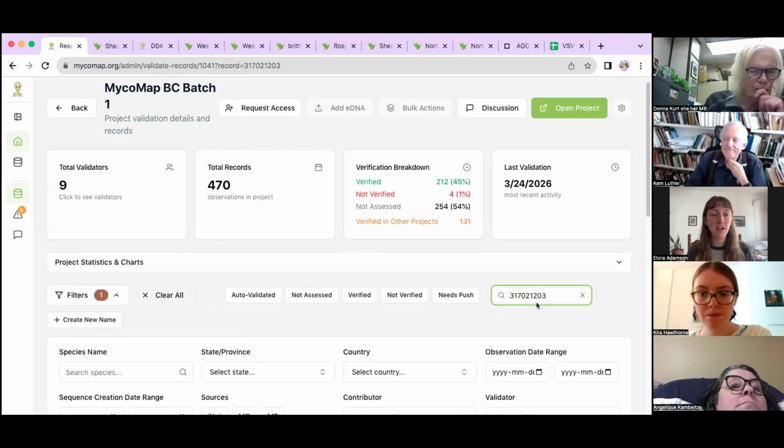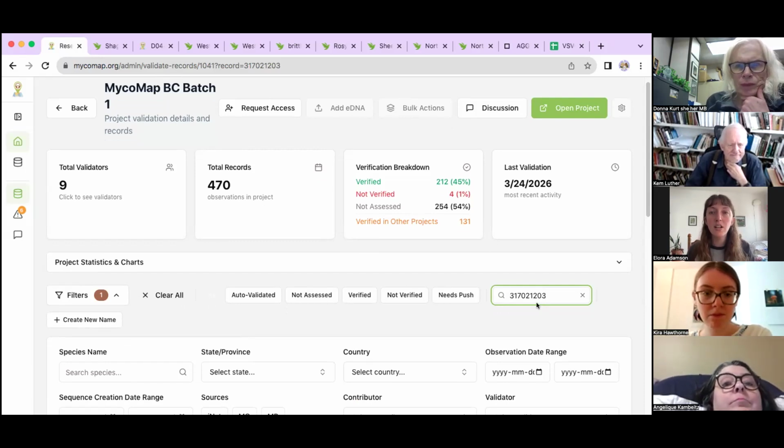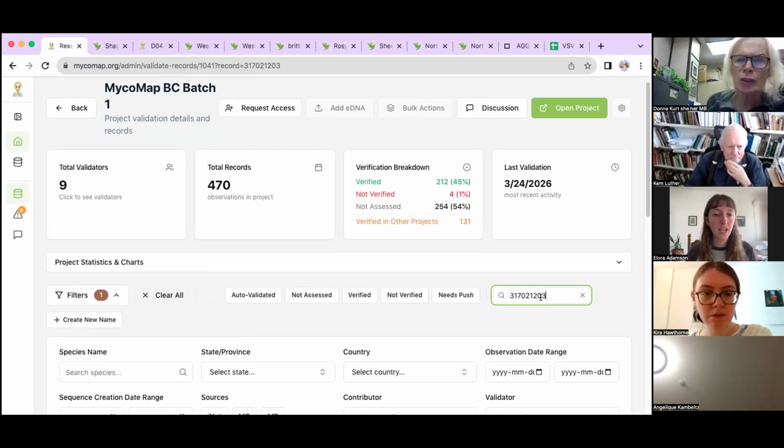So this could be a record that, if it's really not coming up, let's see, 317021203. Yeah, that's the one I originally found, and it was in a BC batch. It comes up for me. I don't know. I think sometimes the filters kind of get stuck.